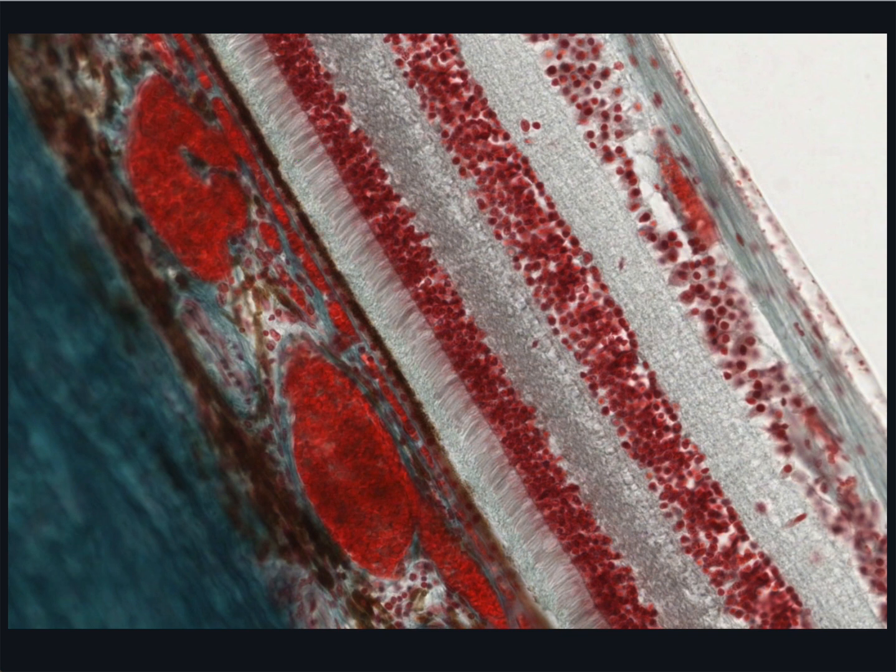Above this layer of inner segments is the layer of photoreceptor nuclei, which is about 5 to 6 nuclei deep. This is called the outer nuclear layer. Between the inner segments of the photoreceptors and the outer nuclear layer is the external limiting membrane, which appears as just a very thin red line, hardly visible here.